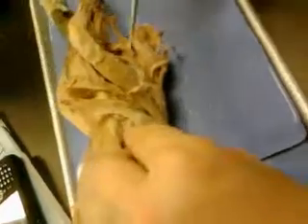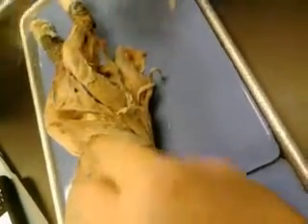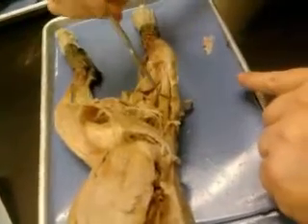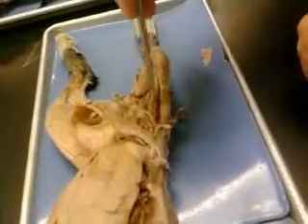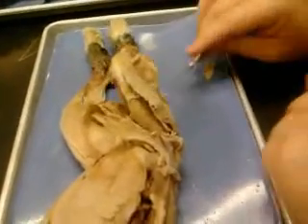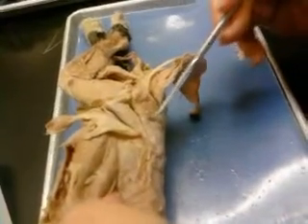The vastus medialis, the rectus femoris, the vastus lateralis, the biceps femoris, the gluteus medius.